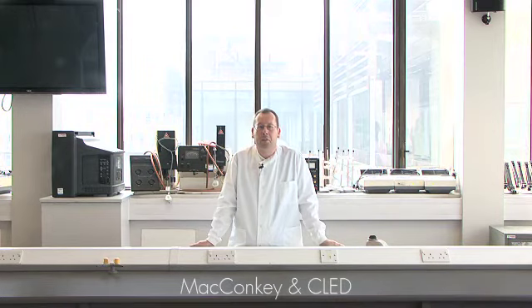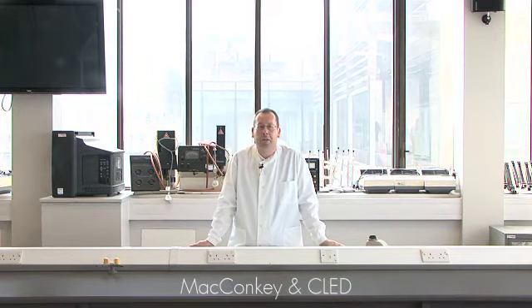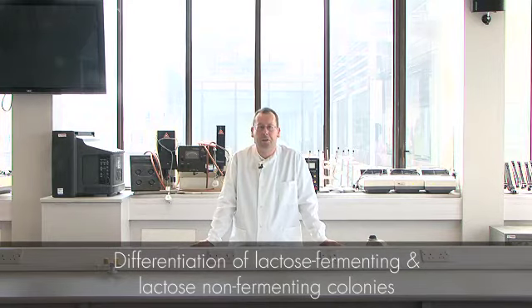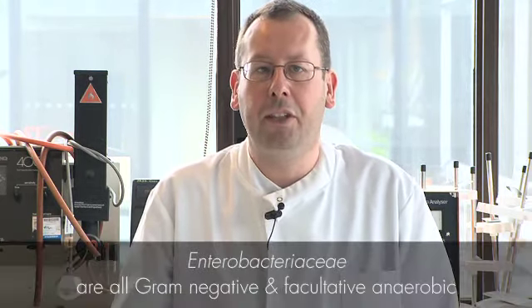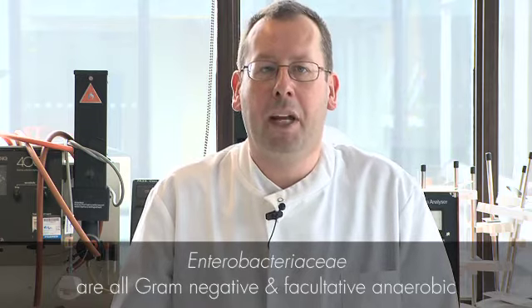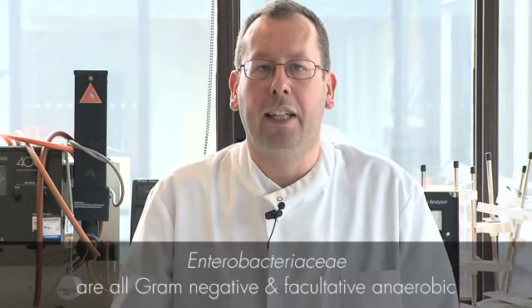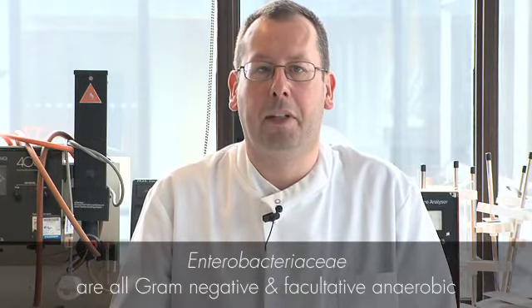Both of these media will differentiate bacterial species which ferment lactose from those which do not. The gastrointestinal tract always contains large numbers of a family of bacteria known as the Enterobacteriaceae. These are all gram-negative facultative anaerobic bacteria, and E. coli is a member of this family. Most of the Enterobacteriaceae, including E. coli, will ferment the sugar lactose.